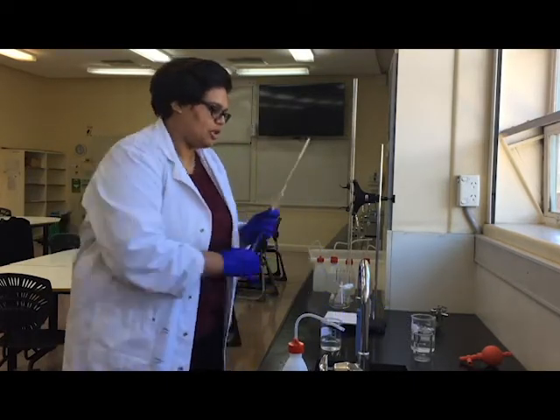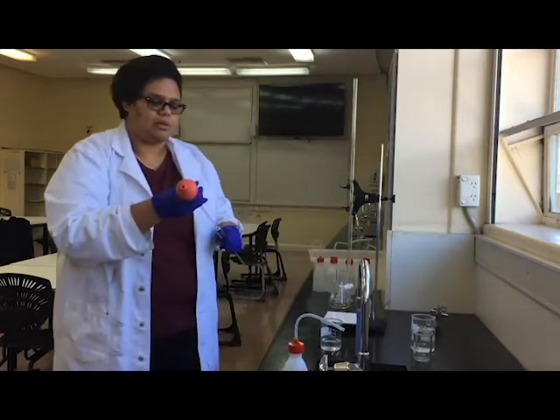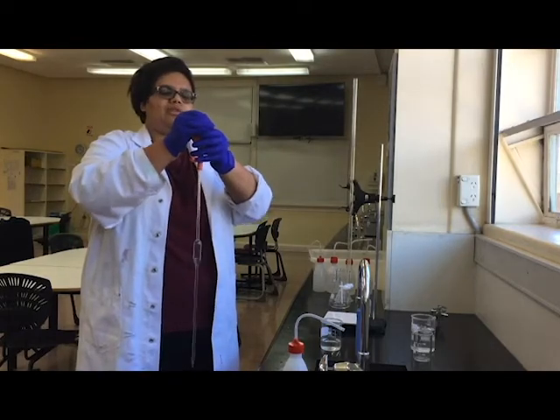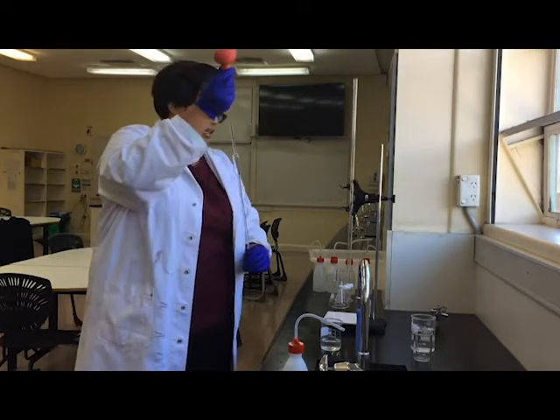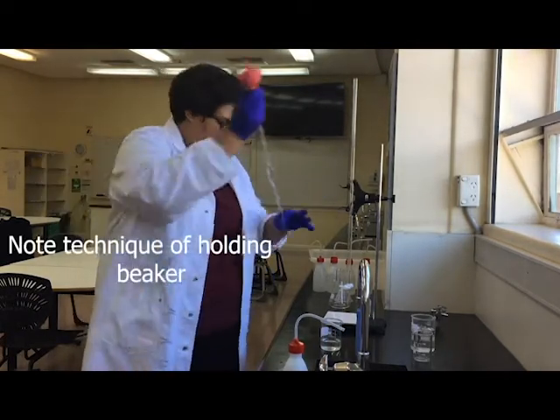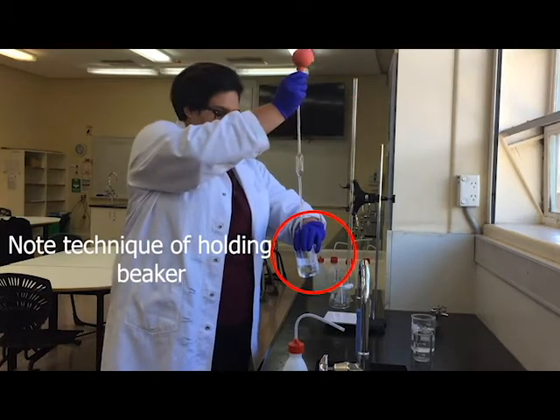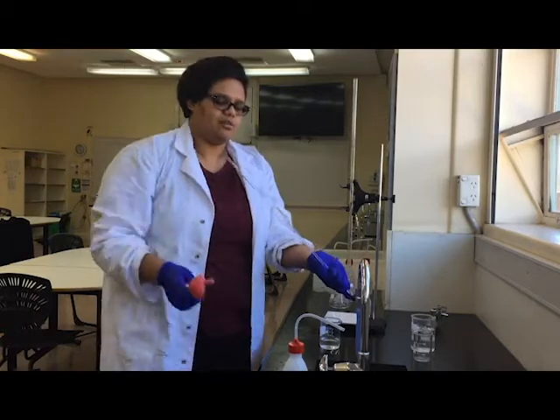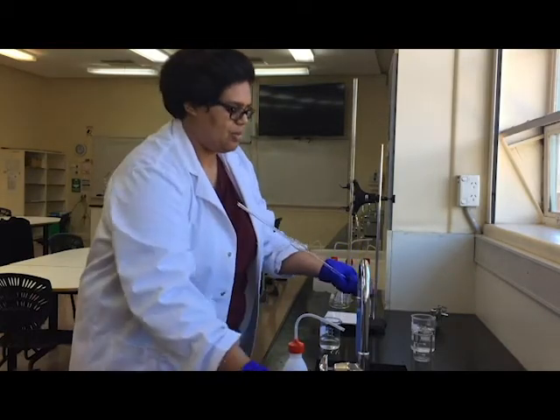So I've sucked up a little bit, just a little bit. I'm going to take the bulb off. Remember, the best way to take it off is to twist it off so you don't break the pipette.